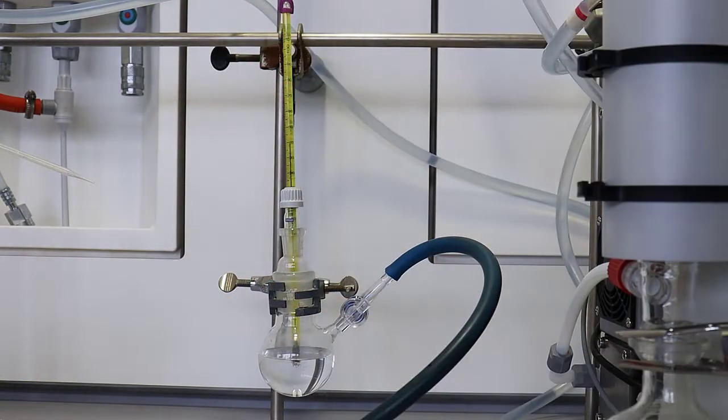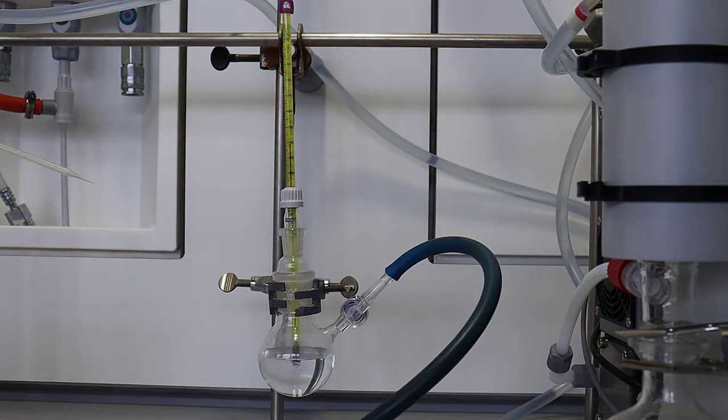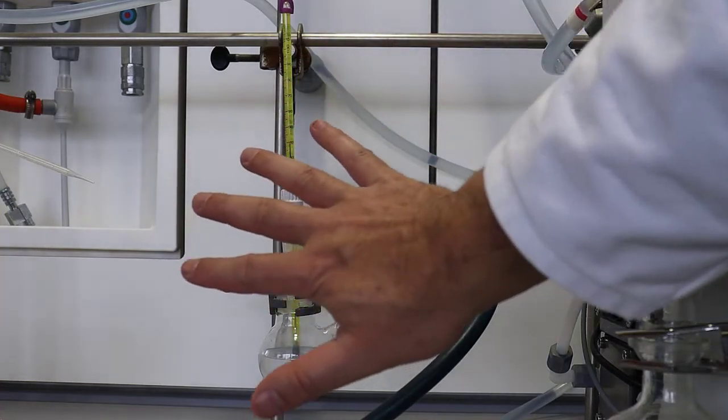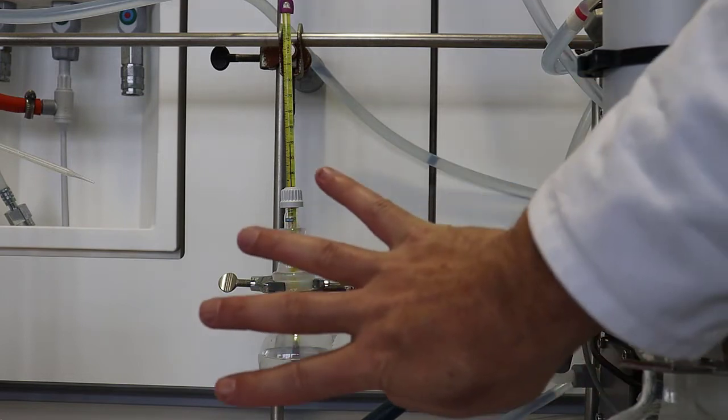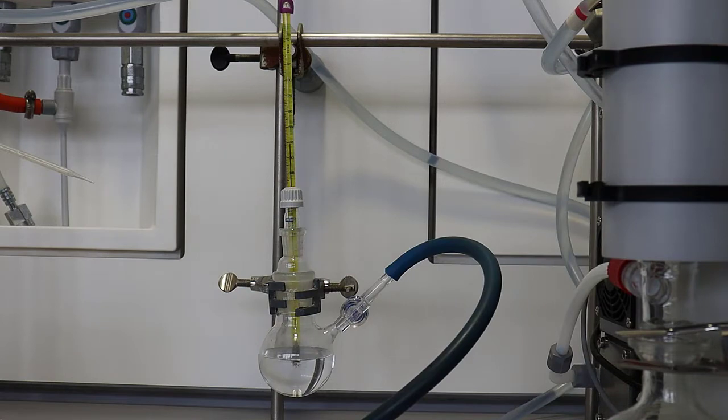And there's my first hand signal of 600 millibar, so we've pumped about half of the air out. You can see that it's gone cloudy at the top of the flask where water's evaporating and condensing. So we've gone down to 500, nothing's still happening. That's unsurprising. We're going down to 400, the pressure in the top of the flask is going down and down. And nothing exciting is happening as one would expect.